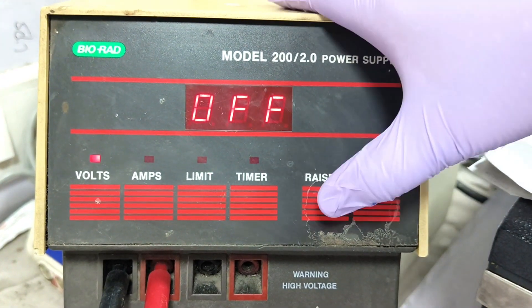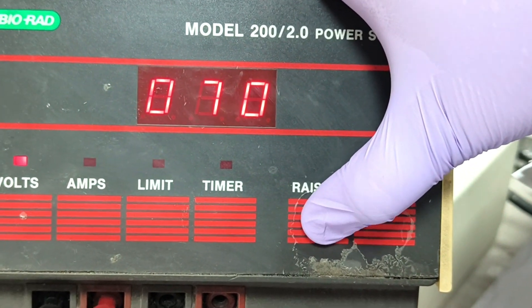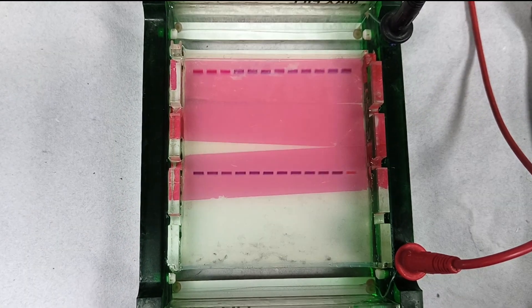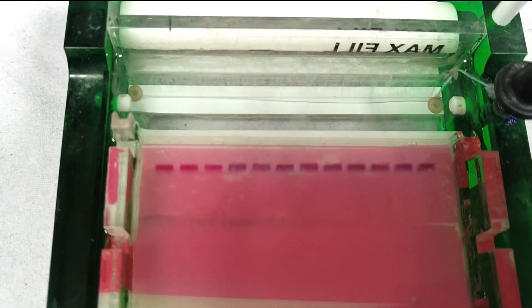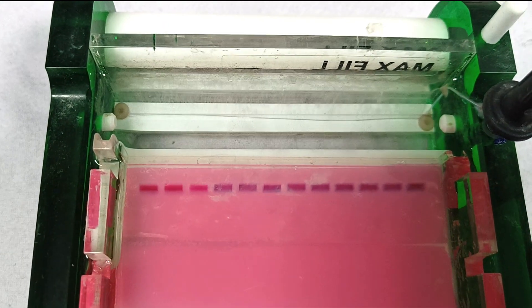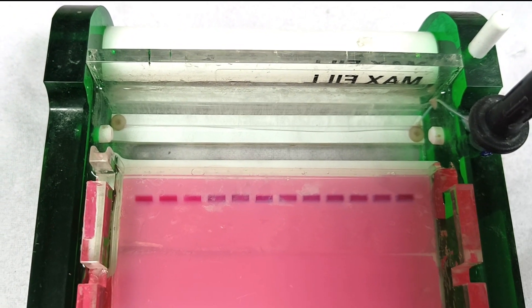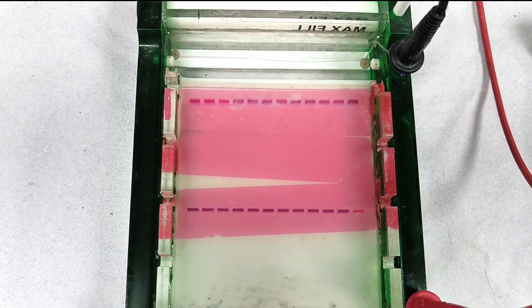Set the voltage of the power supply connected to the electrophoresis tank and start the supply. Now you can see some bubbles start coming out of the cathode side. This confirms that the gel run is now on. Allow the gel to run for about 40 minutes.